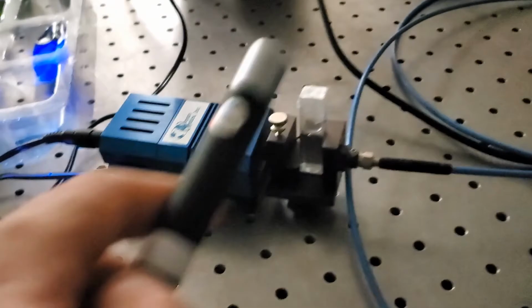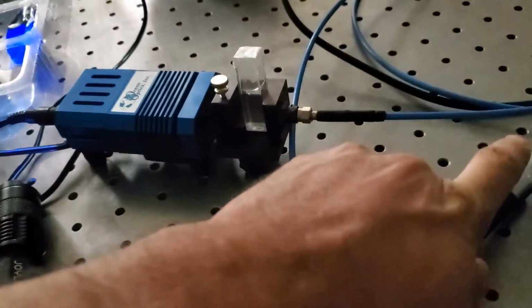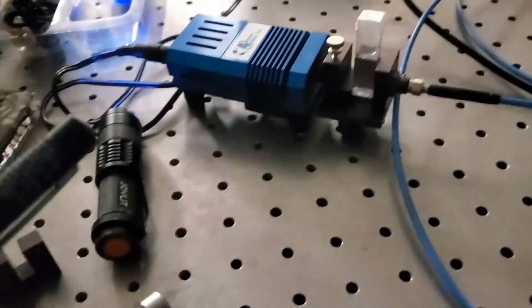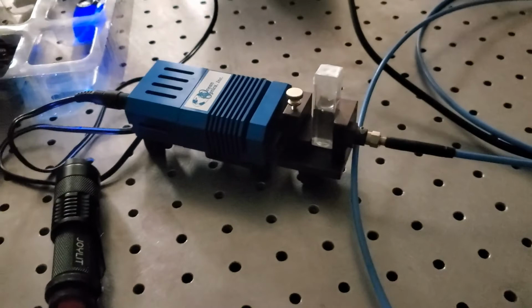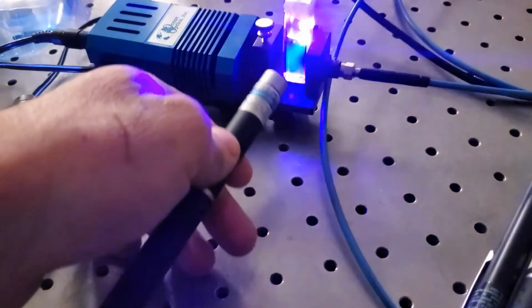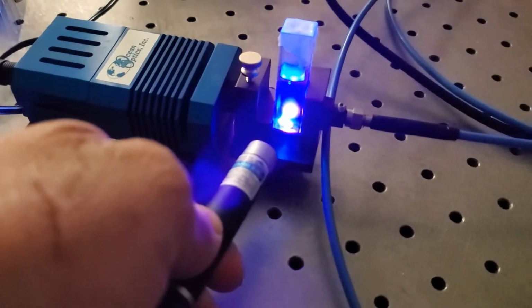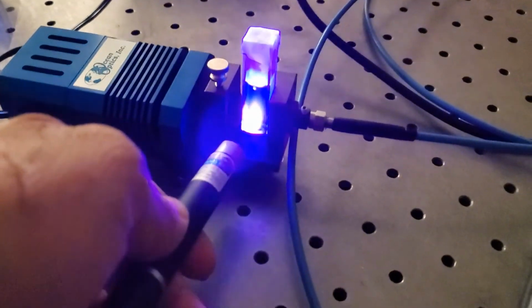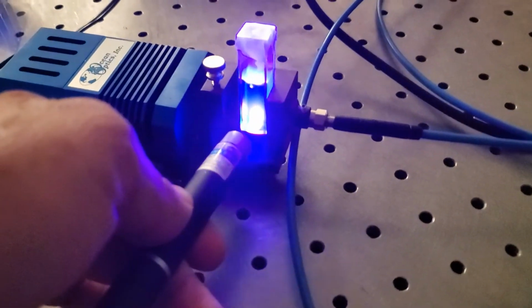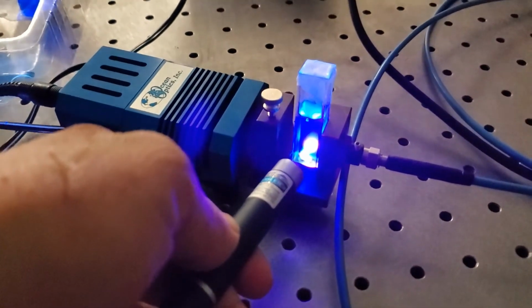Same thing with quinine. The green does not cause it to fluoresce, and if that's true, then the red is also not going to cause it to fluoresce. See that right now. There we go. It fluoresces blue, even though the 405 nanometer violet kind of overtakes it when I'm trying to film it, but I can see it with my eyes that there's a wavelength difference.